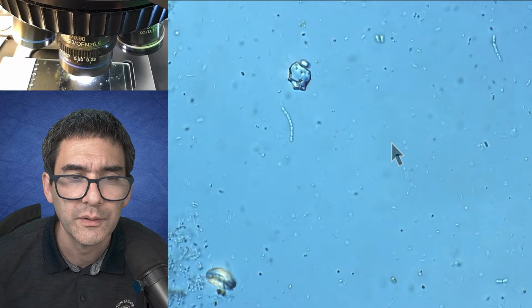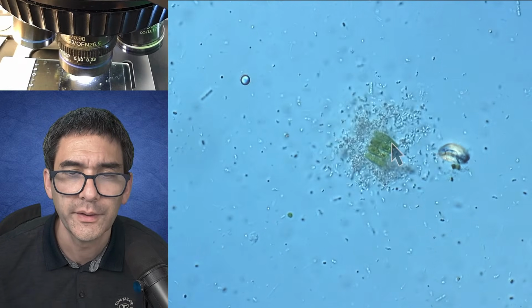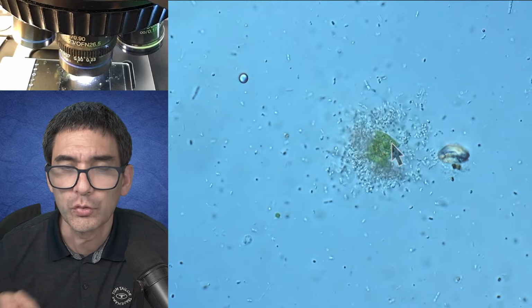Also, quite so, here is, oh, look at this here as well. Sometimes you see this happening after some time, when the oxygen level drops.